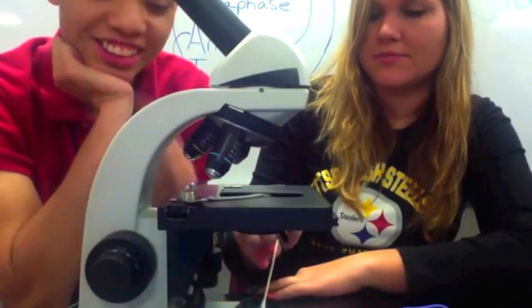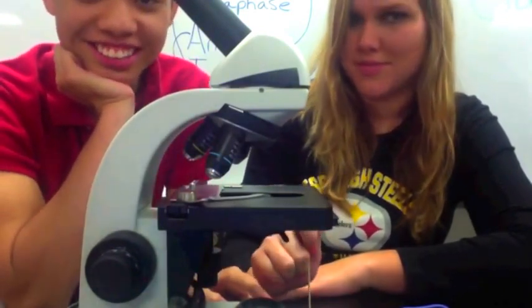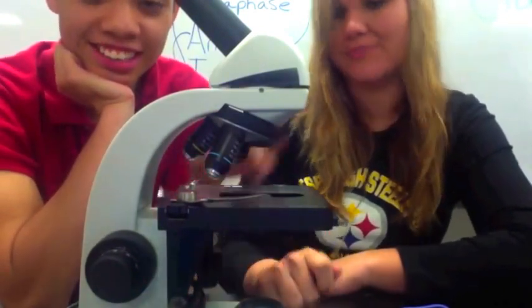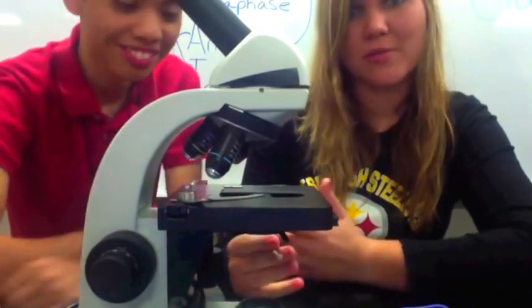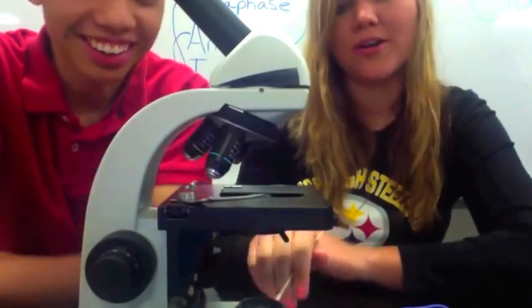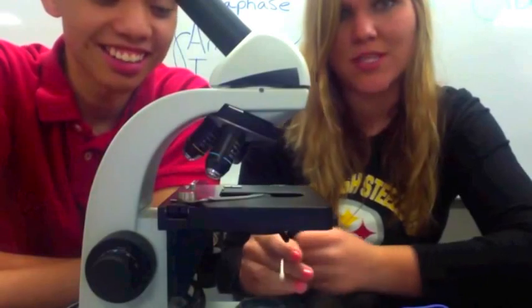This down here is called the sub-stage light — sub-stage light — because it's under the stage. Like a submarine goes under the water, this light is under the stage. So: sub-stage light.